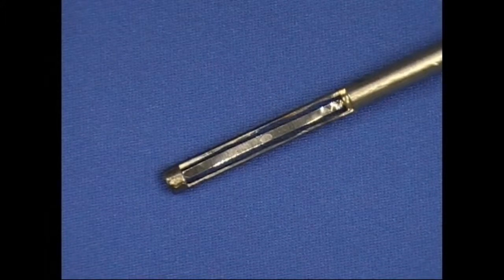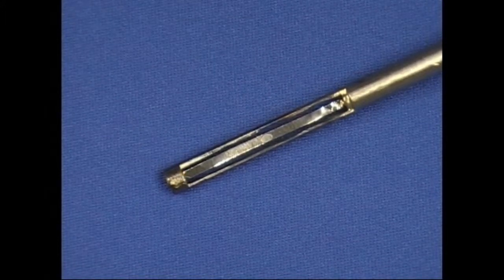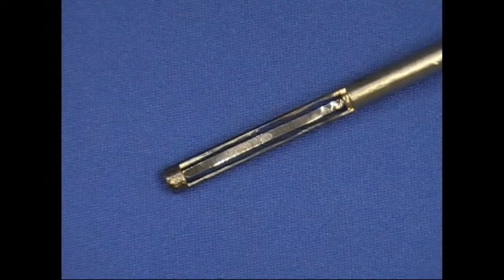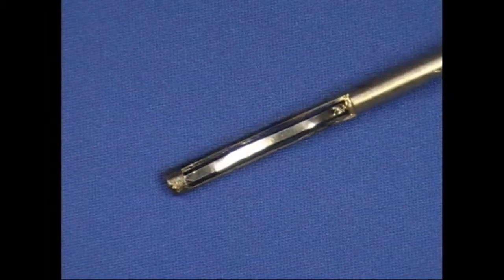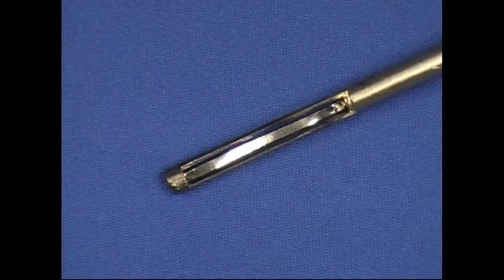There are two ways to put a sample onto the ribbon probe. You can take a small piece, particularly a polymer that will melt at a low temperature, place it directly onto the filament, use the dry function to warm the sample and make it stick to the filament, and then put it into the pyroprobe.